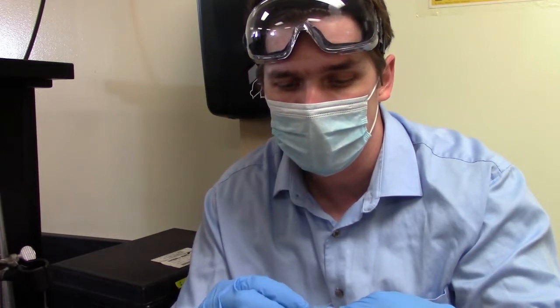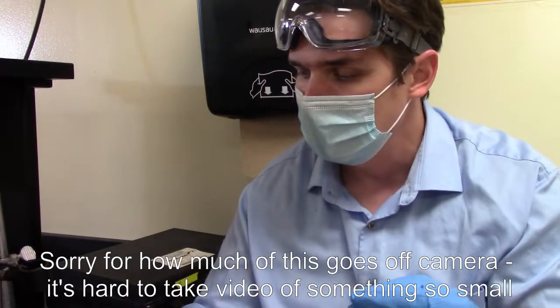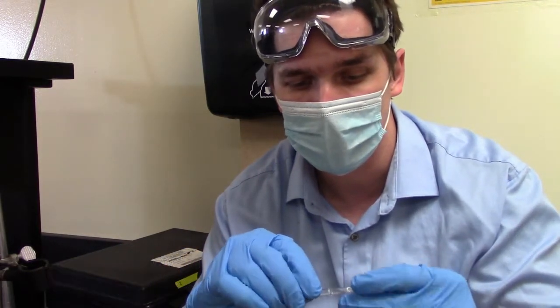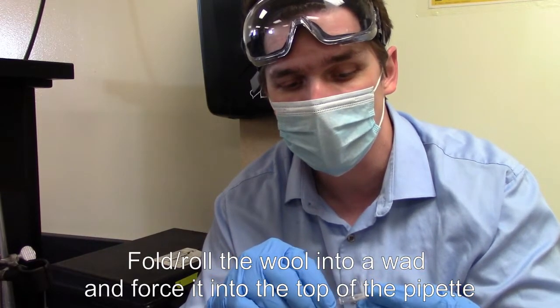Now for the glass wool itself, I'm going to kind of rotate it and kind of pack it down into this little wad. Then I'm going to take this wad and I'm going to push it into the top of the pipette. And I'm sorry for not putting my goggles down, but I do kind of need to see this, particularly for this video.